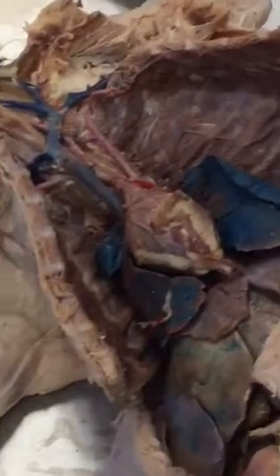And then after that, of course, would be your axillary. You can follow it out there. That's your axillary here. And then to your brachial. So it's not very mysterious. Right there. You won't know it today because you just started, but once you know your diagram, you'll be able to find them.